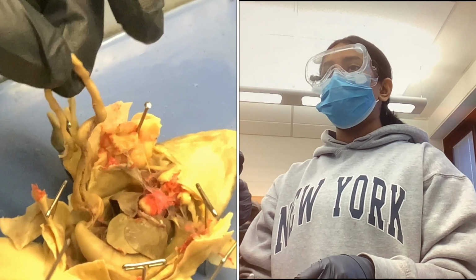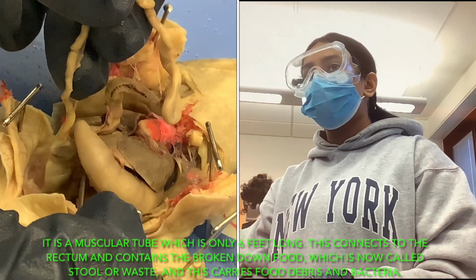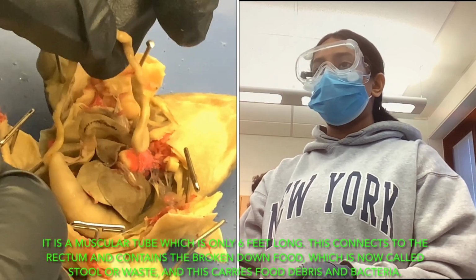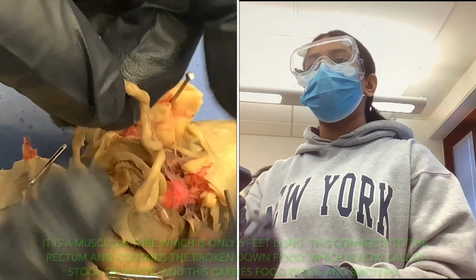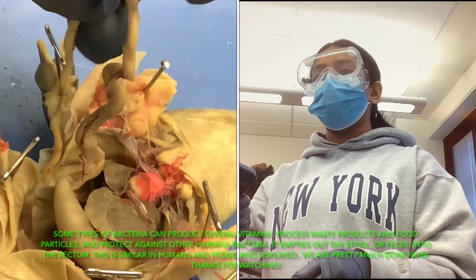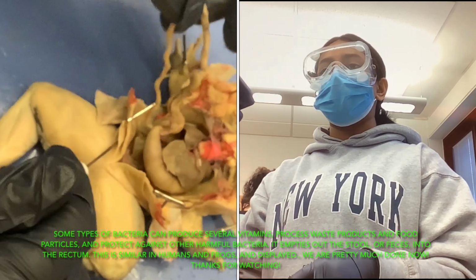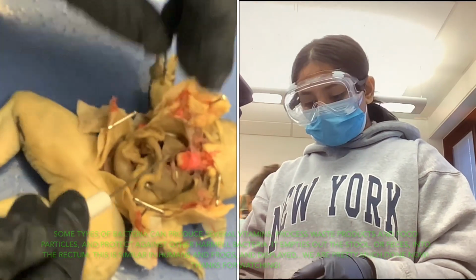The large intestine is also called the colon. This part is a muscular tube which is only 6 feet long in humans, at least. It connects to the rectum and it contains the broken down food, which is now called stool or waste. It carries food debris and bacteria. Some types of bacteria in it can produce several vitamins, process waste products and food particles, and protect against other harmful bacteria. It empties out stool or feces into the rectum. And we are pretty much done.